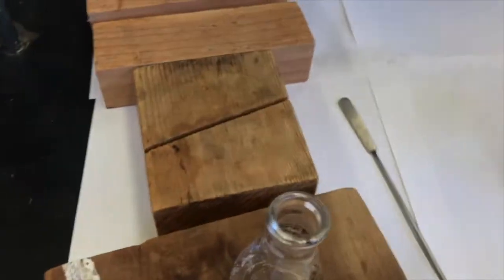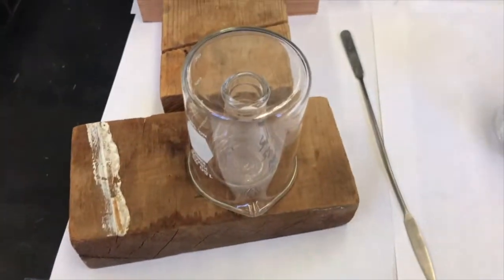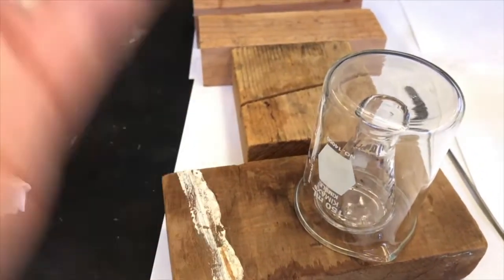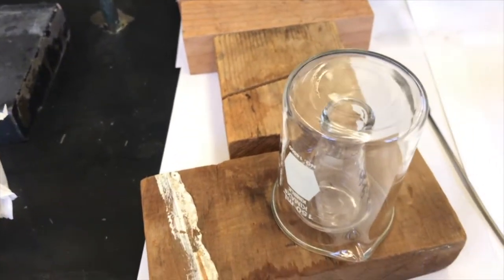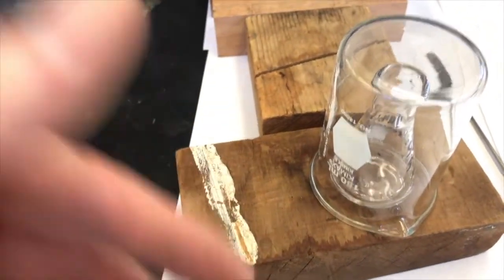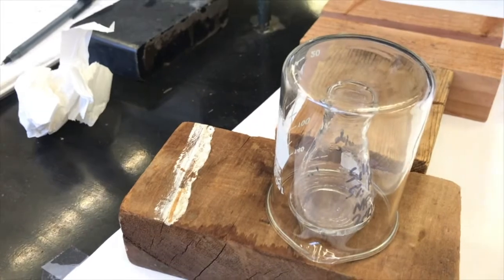And I can also grab a beaker and set it over the top, and that will slow the cooling as well, because as this hot ethanol is evaporating out of the solution, it evaporatively cools. If I put a beaker over it, it's trapping a lot of the ethanol gas, which slows down evaporation, slows down evaporative cooling. So if I leave this here, I should start to slowly see crystals soon.